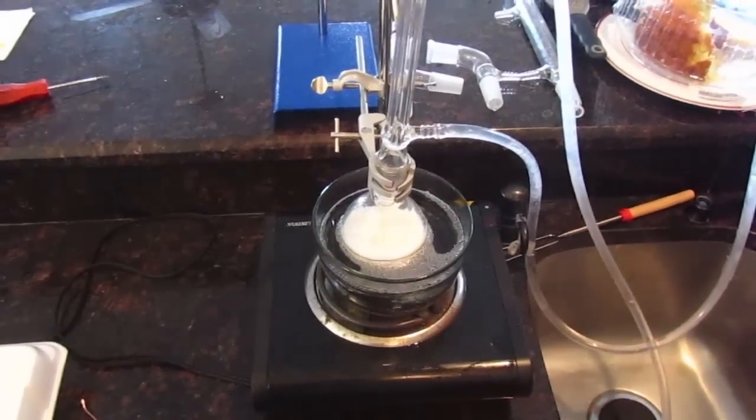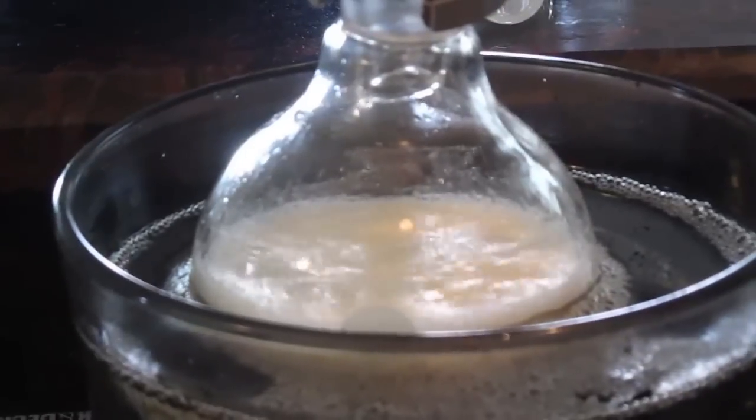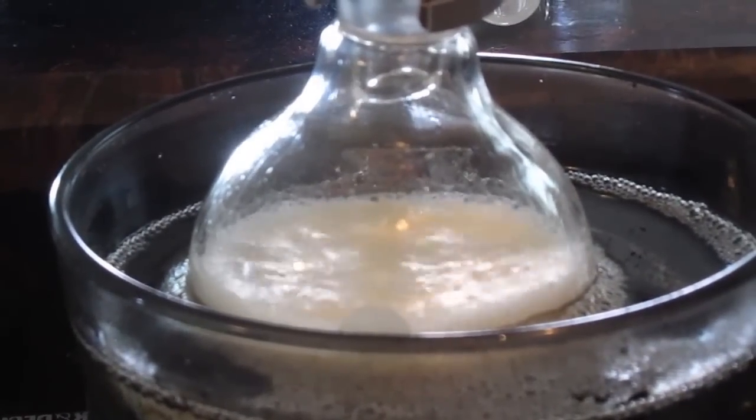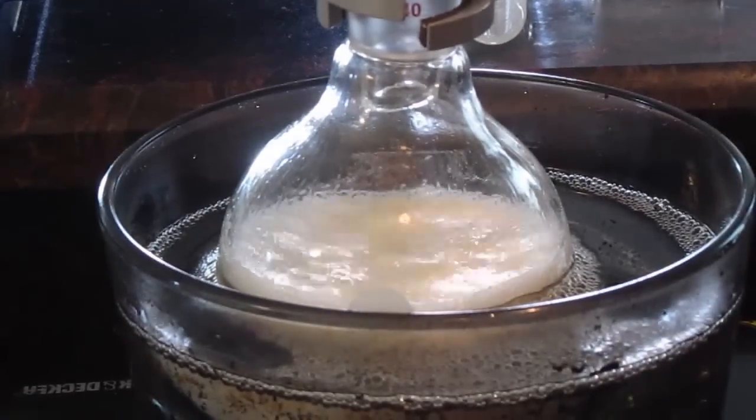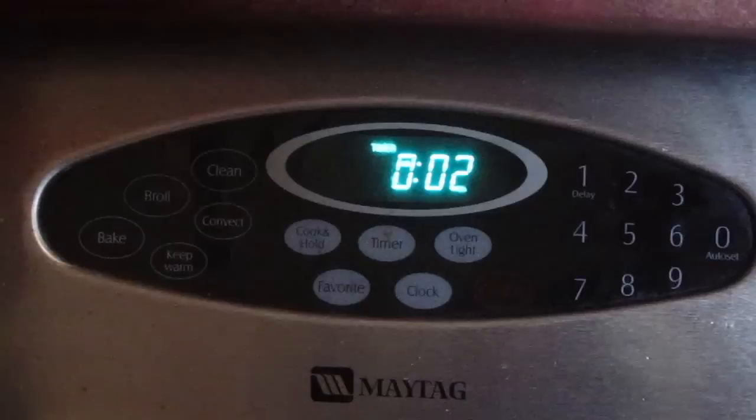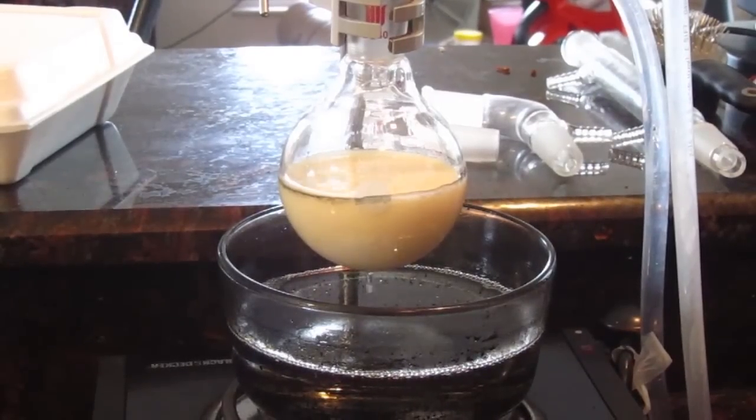Next, we set up for reflux and set the timer for 90 minutes, one and a half hours. Everything is going smoothly-ish, and we have a nice condensation front. Well, it looks like the time is almost up, so let's take it off and let it cool.